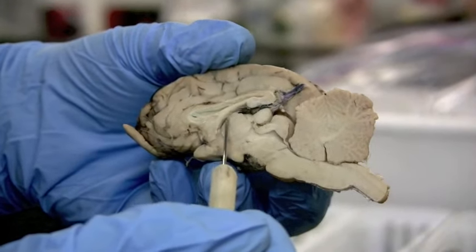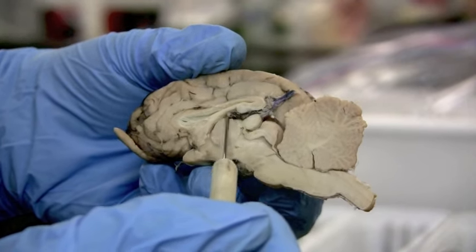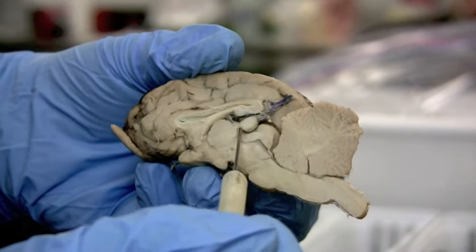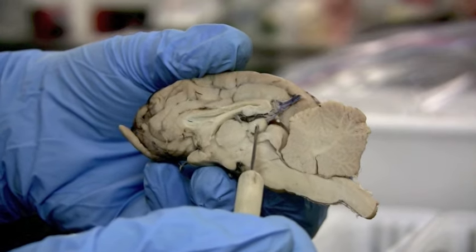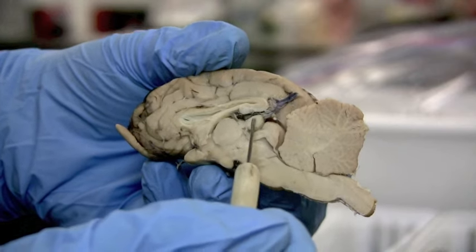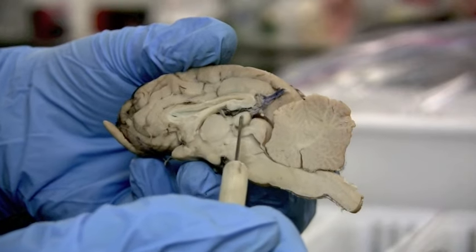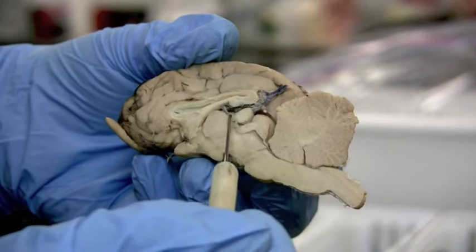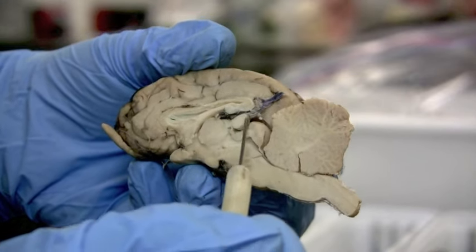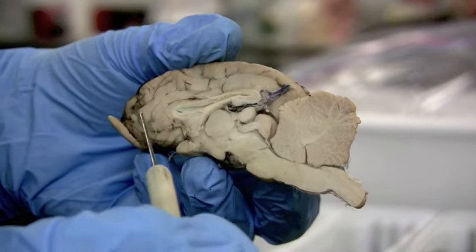The epithalamus is upon the thalamus and it's going to go over the top of the thalamus, just a very thin line that's going to end here in this round structure — the pineal gland, which produces melatonin that helps regulate your circadian rhythms. The big round circle is the thalamus; the smaller round circle behind it is the pineal gland. The epithalamus connects them.